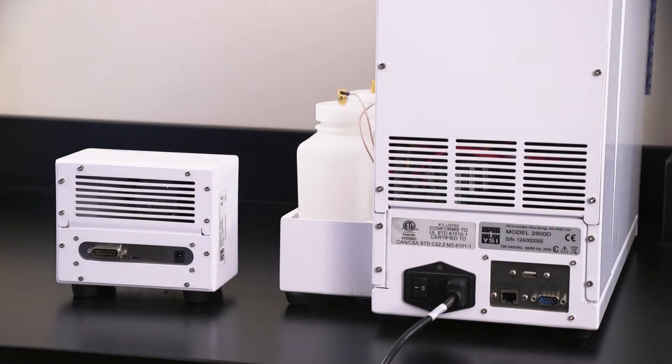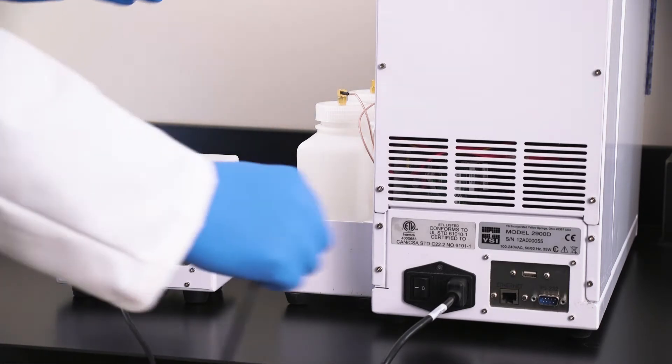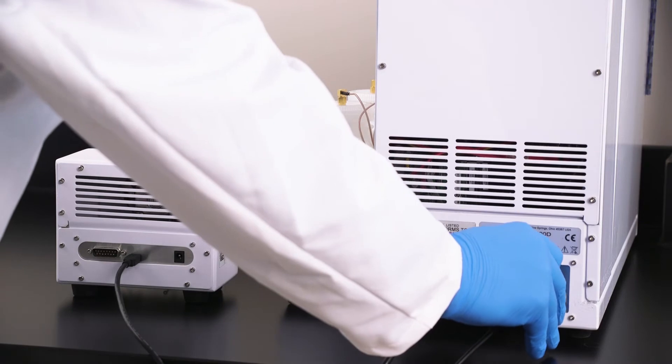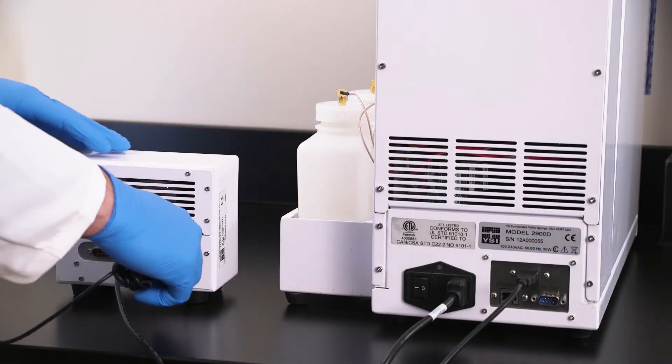Connect the USB cable from the back of the online monitor to the back of the 2900 series analyzer. Connect the power cable to the back of the online monitor.